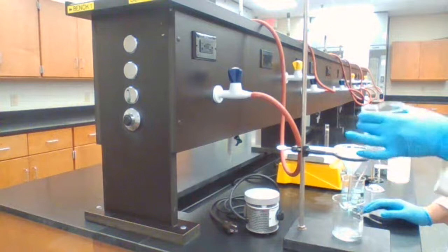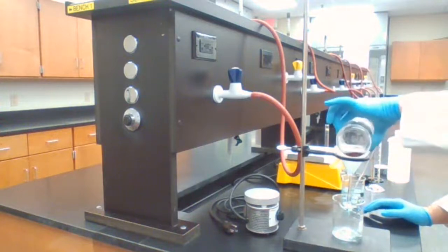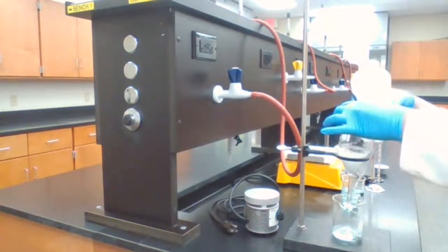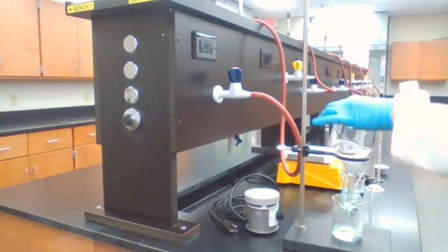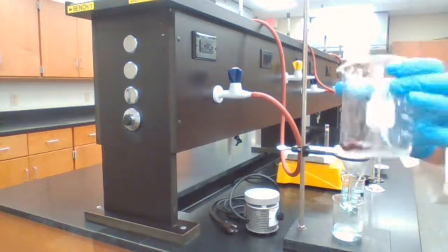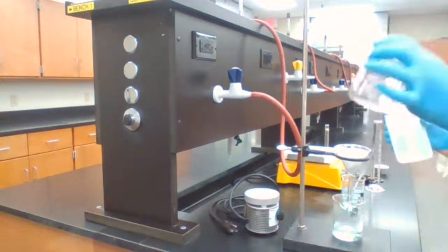And if there is anything left over in the beaker, what we can do, we could add some distilled water and wash it with the distilled water and transfer into filter paper. Probably could see the red color more obvious and better now for formation of the copper.